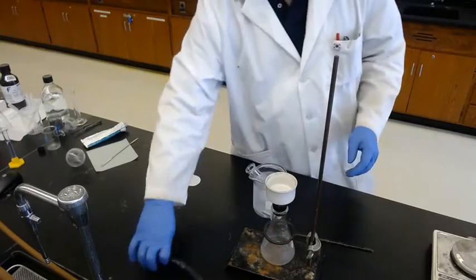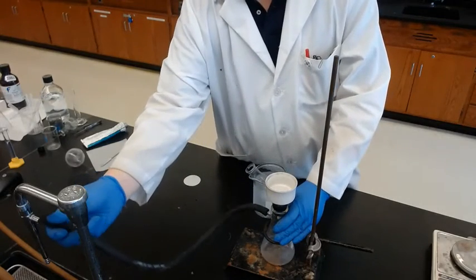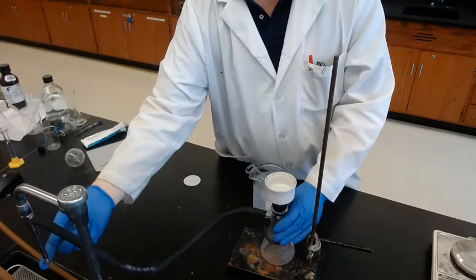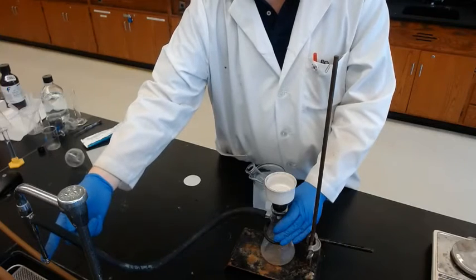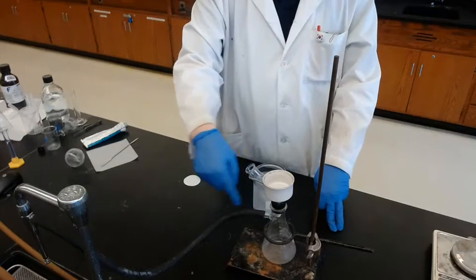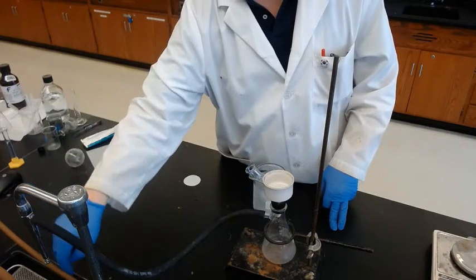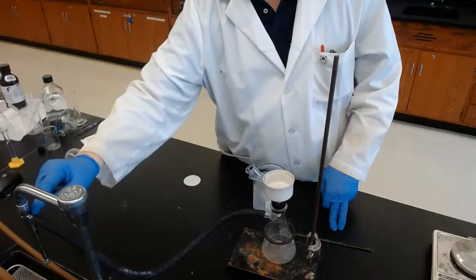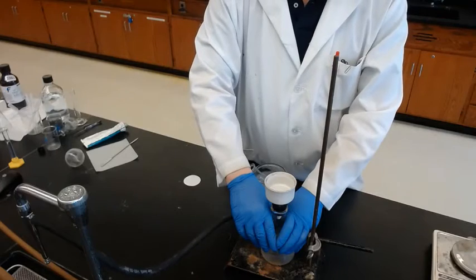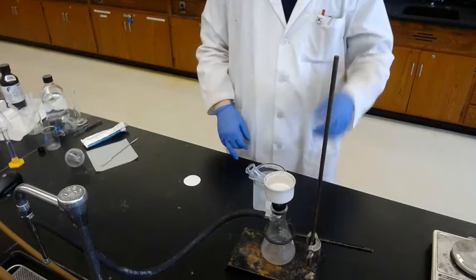And while we are waiting, we connect the water tube to the side of the water tap. Don't connect this to the bottom of the water tap, because sometimes people make a mistake: water going in does not make a vacuum inside the flask, it just fills the flask with water. So think about the side. When the water is on, water goes down, and air from the side is also sucked together. So the flask becomes under vacuum. Vacuum is much stronger at pulling than gravity.